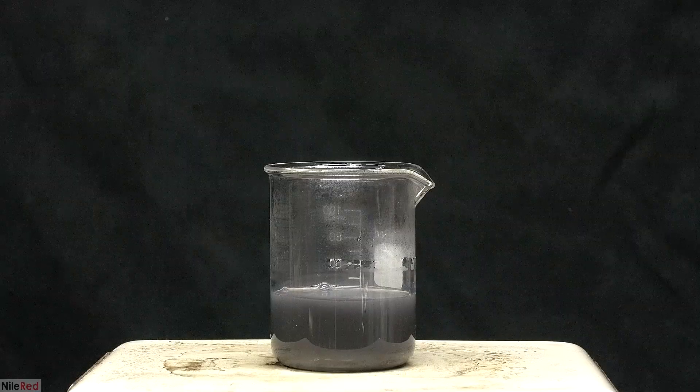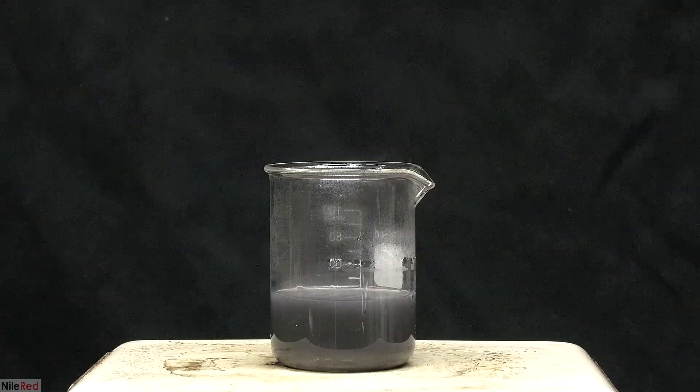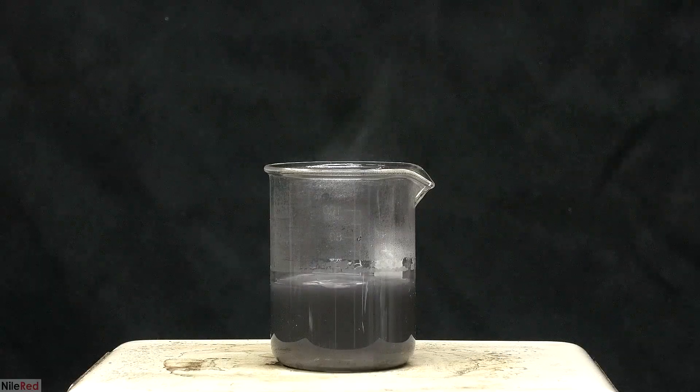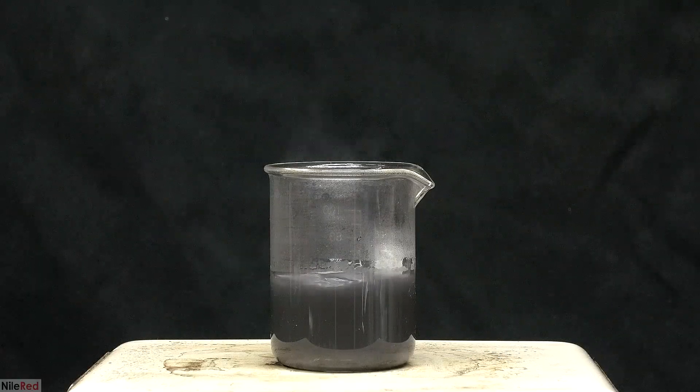The reaction at room temperature is slow, but as they react and generate heat, the reaction will speed up. As the solution gets hotter, we'll start to see steam coming off and a bunch of bubbling.